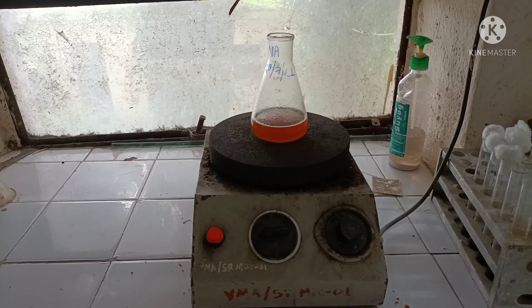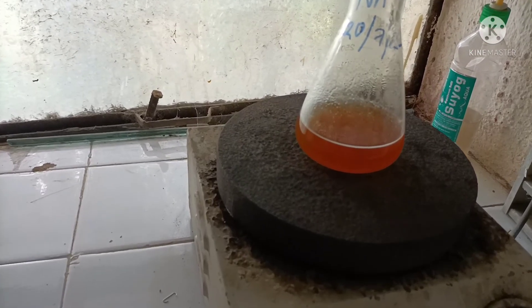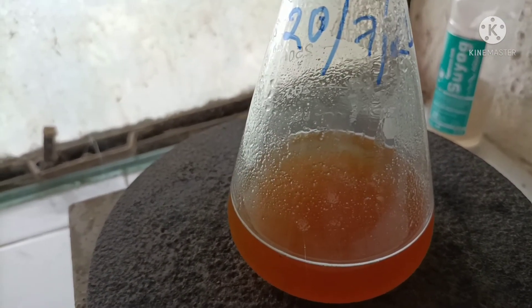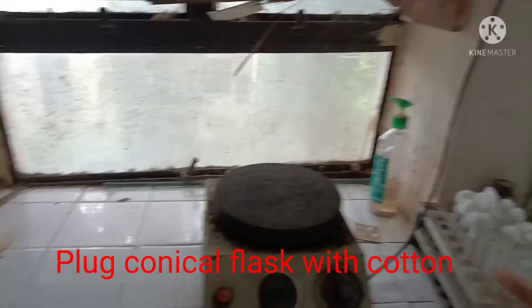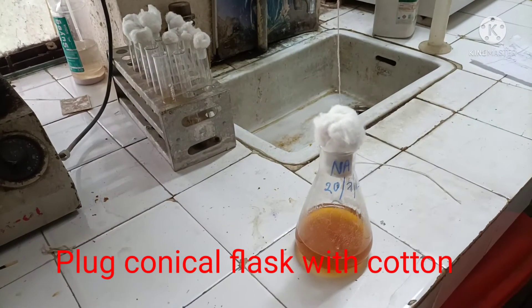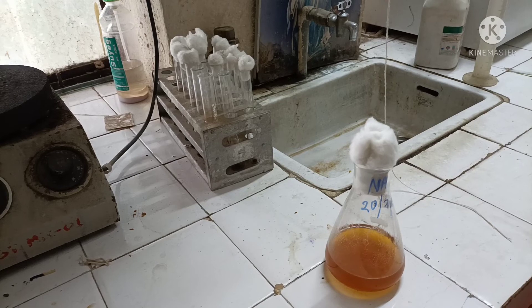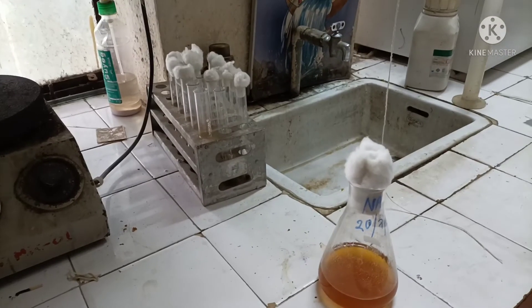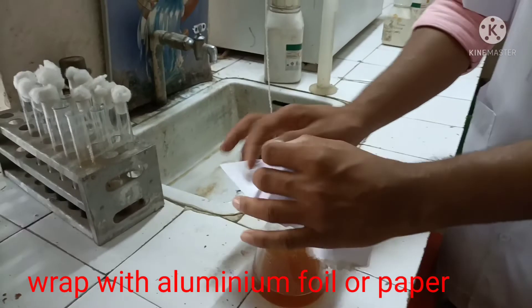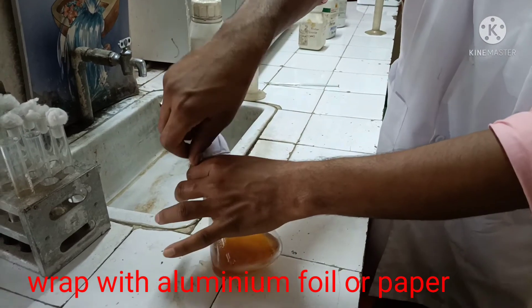The nutrient agar medium is heated and boiled for a few minutes until all ingredients are completely dissolved. Then we plug it with cotton, which allows only filtered air to enter — the fibers of the cotton trap dust particles and microorganisms while sterile air passes through the pores. Then we wrap it with aluminum foil or paper if aluminum foil is not available.